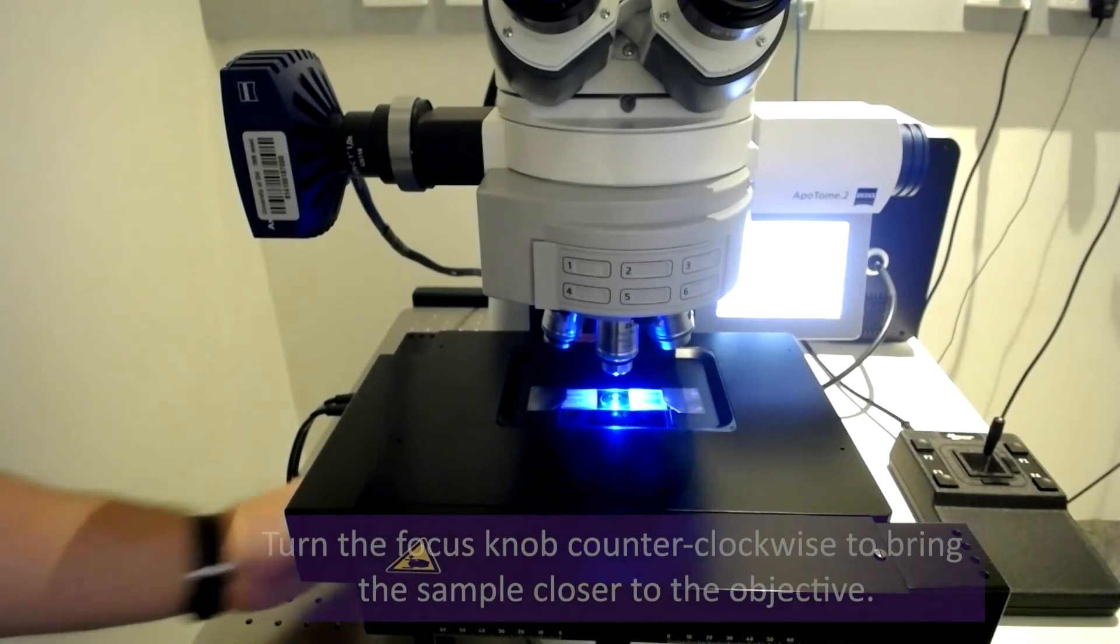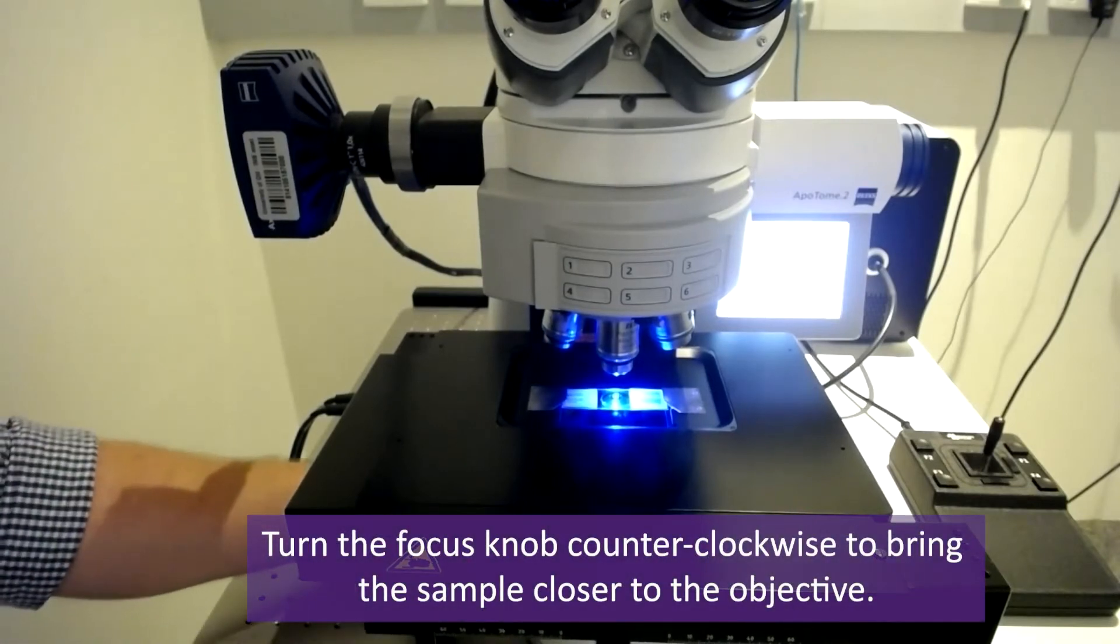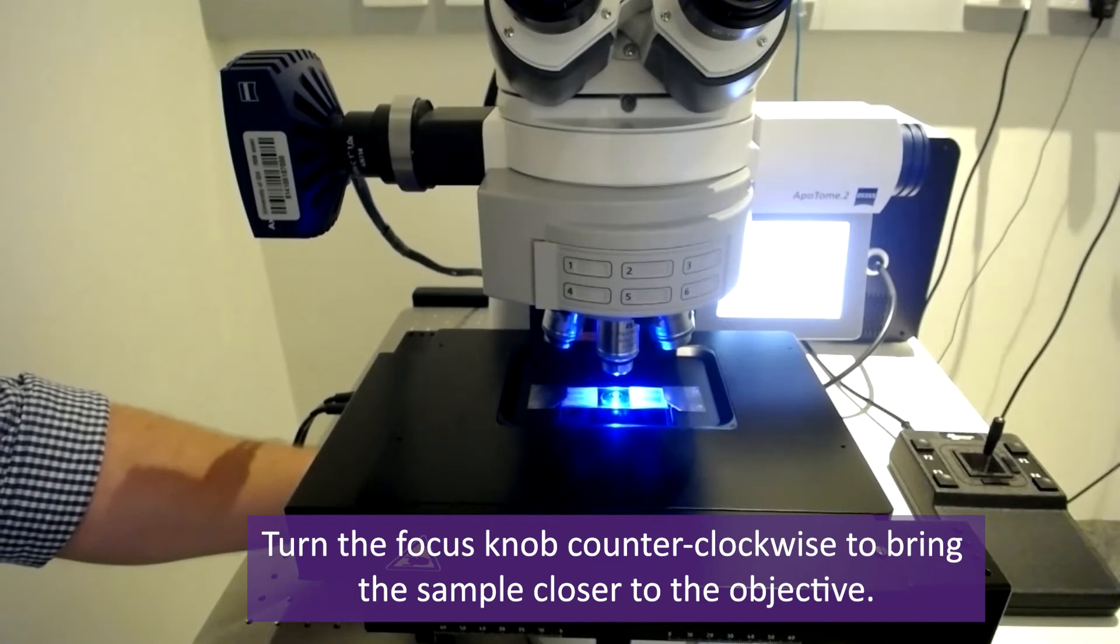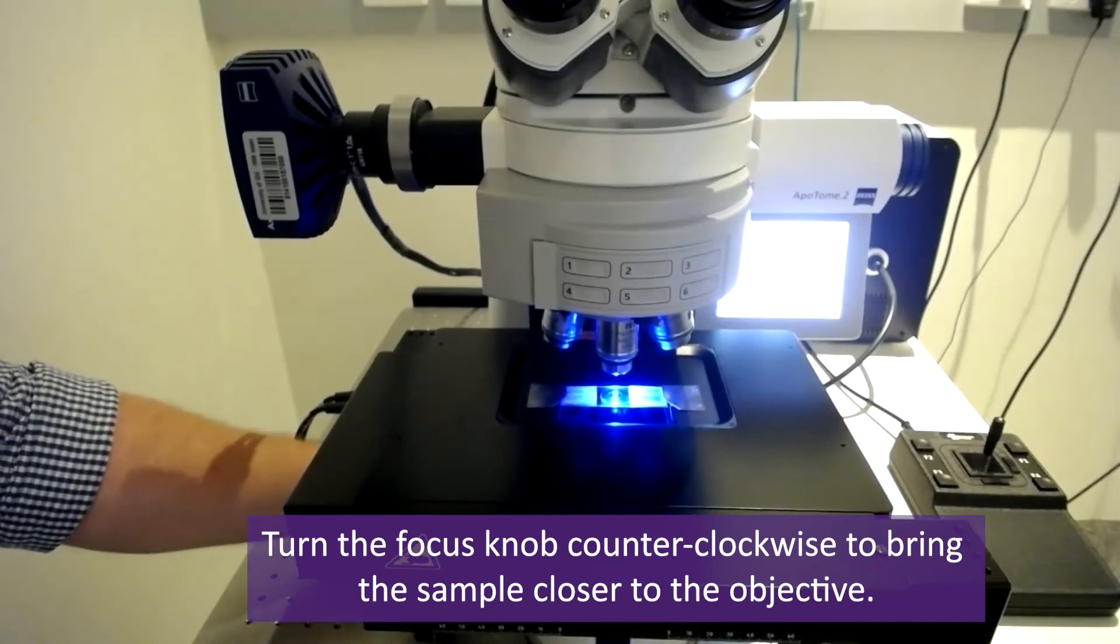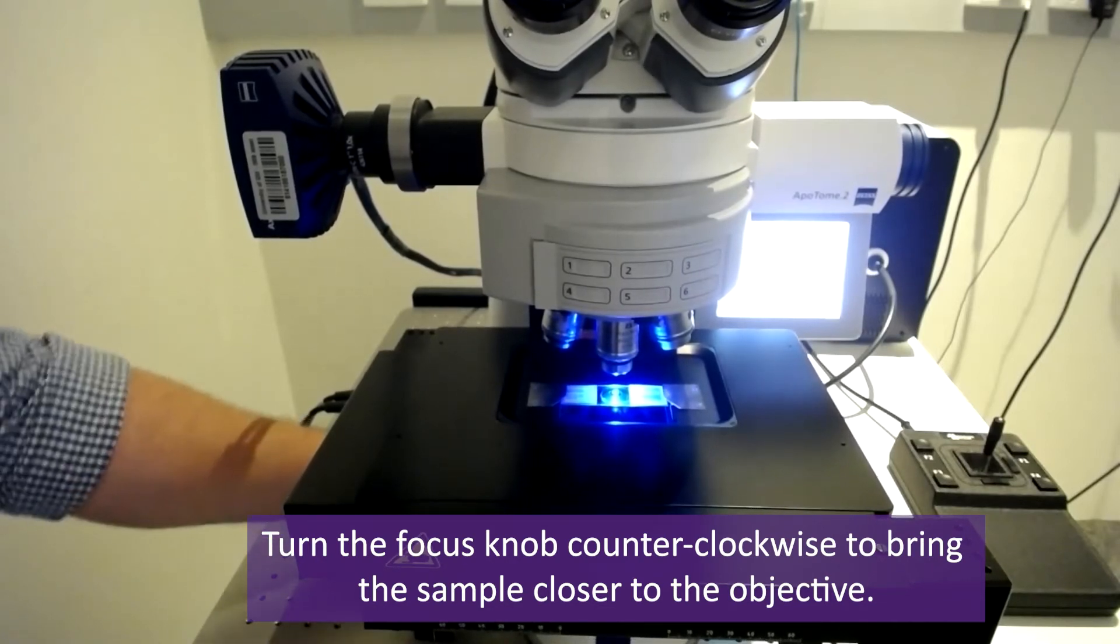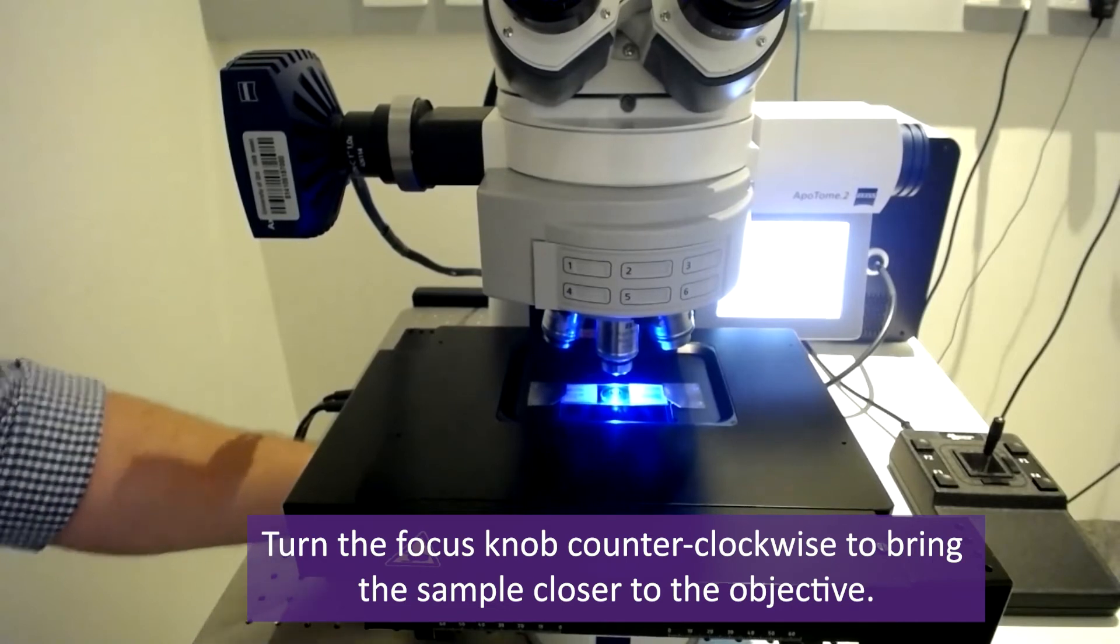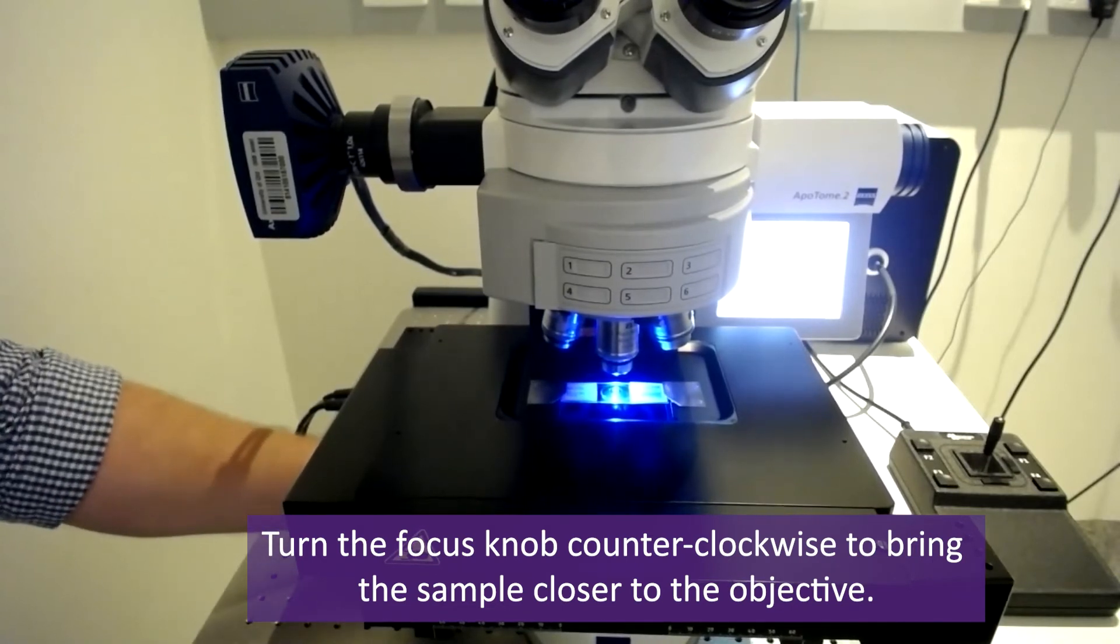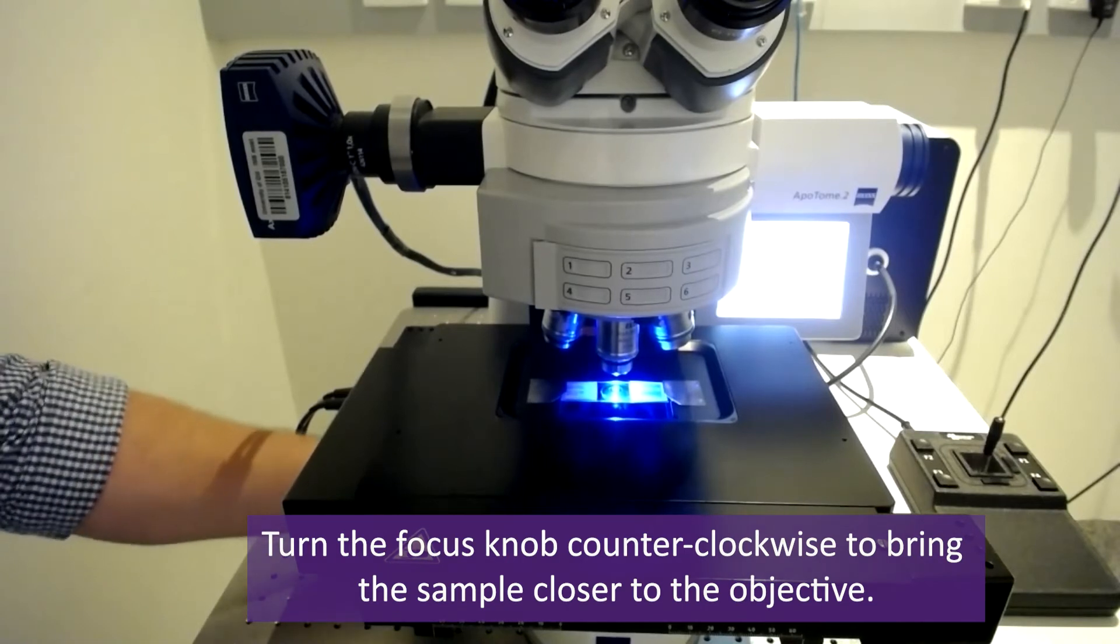I'll place the oil back in the container on the table and begin to wind the stage towards the objectives by rotating the focus knob counterclockwise or over and away from you. When the stage is fully lowered, it can take a few turns to rise the stage to the focus position.